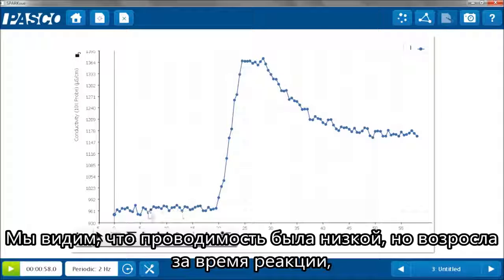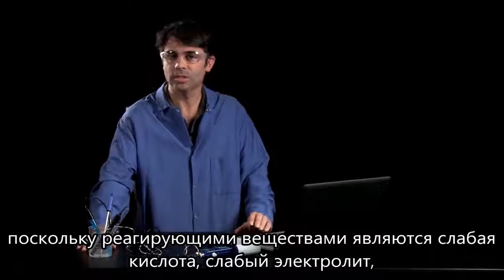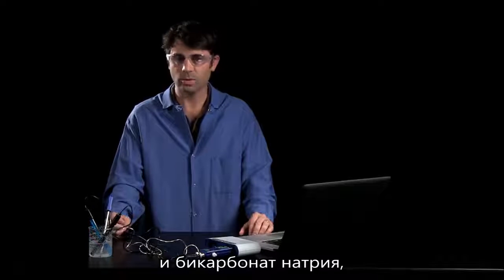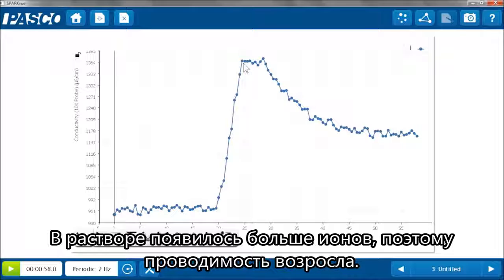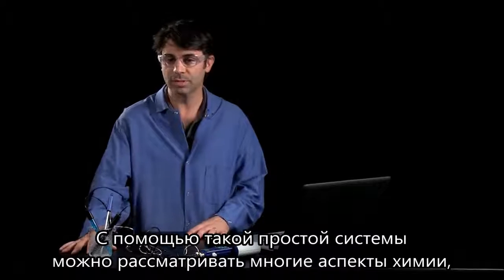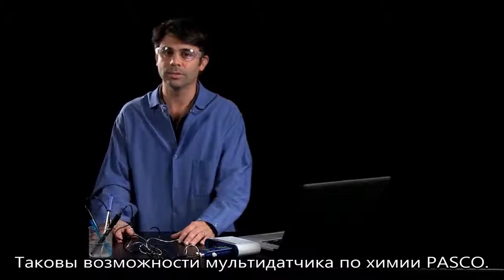The conductivity was low, and it shot way up as the reaction proceeded because you were reacting a weak acid, which is a weak electrolyte, and you're adding in sodium bicarbonate, and you're producing the CO2 and some sodium acetate. So now I have more ions in solution, so my conductivity increased. You can really get at a lot of the chemistry concepts with a very simple system as long as you can make all those measurements. And that's what the Advanced Chemistry Sensor allows you to do.